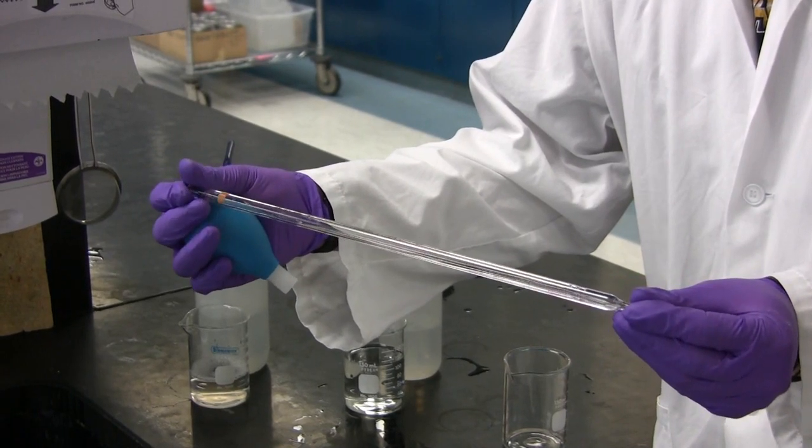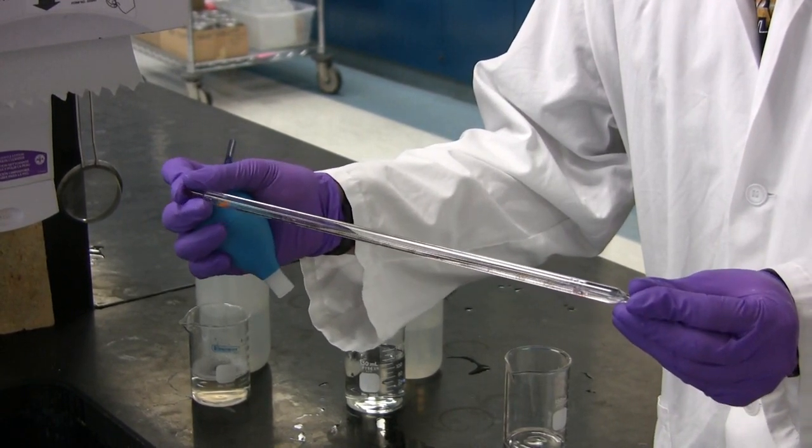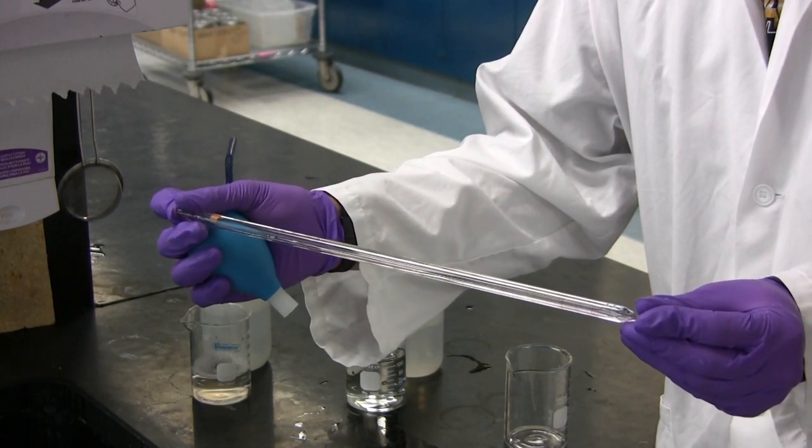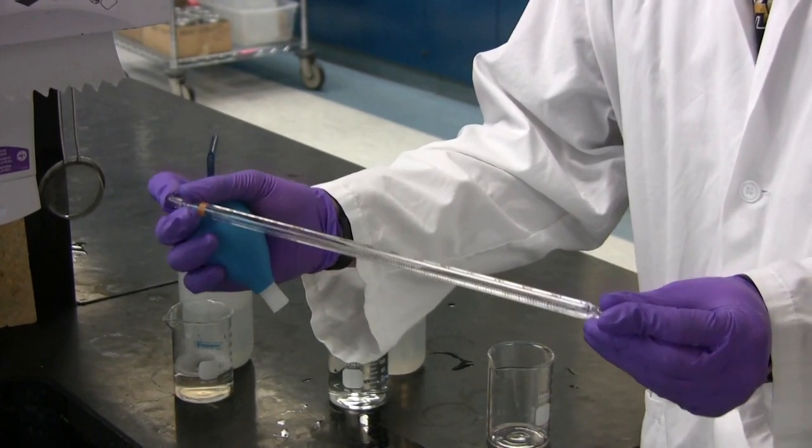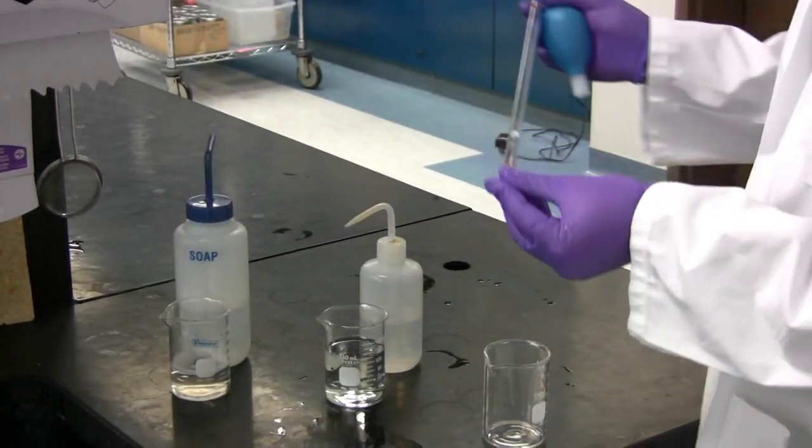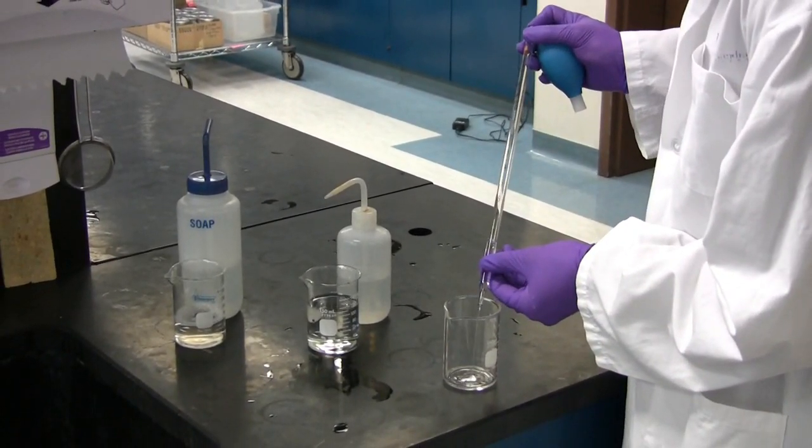Lastly, you need to rotate it towards yourself to ensure coating of all sides. Once that is finished, you need to drain this into a waste beaker.